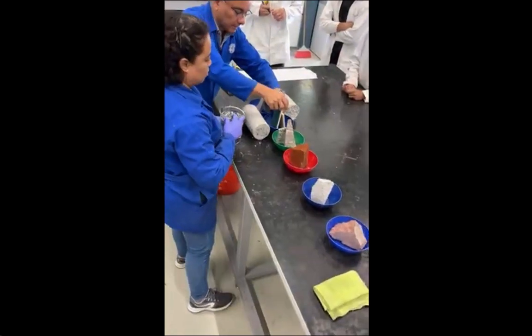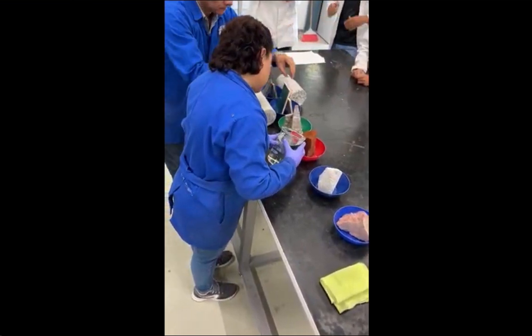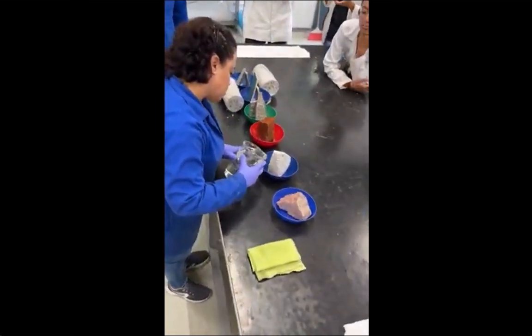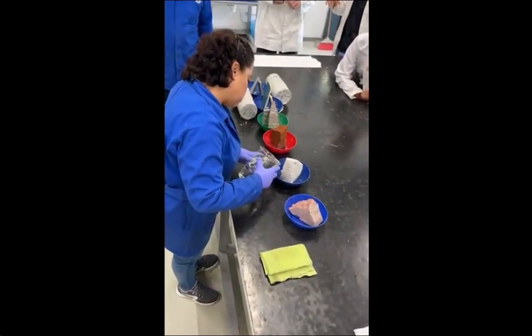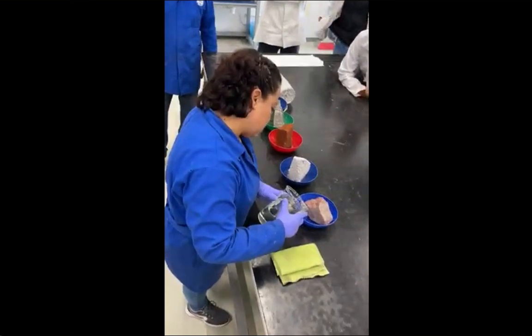The materials used in this experiment were limestone rock, ceramic tile or ceramic floor, a piece of singular brick, porous concrete with mineral color, sodium sulfate, and 6 plastic containers.